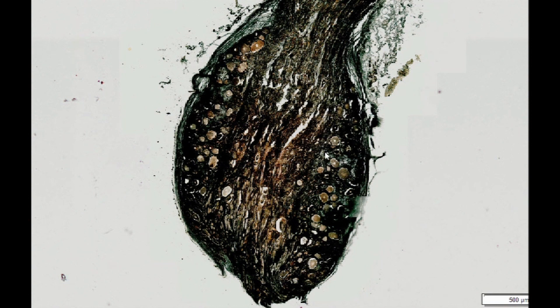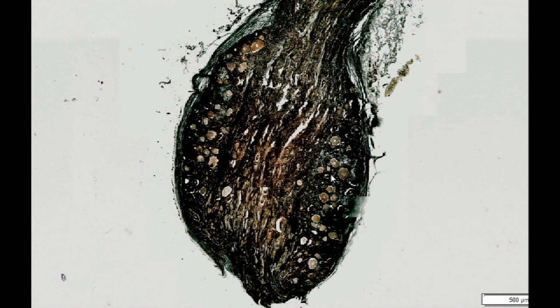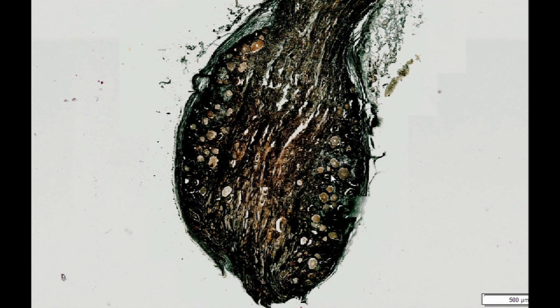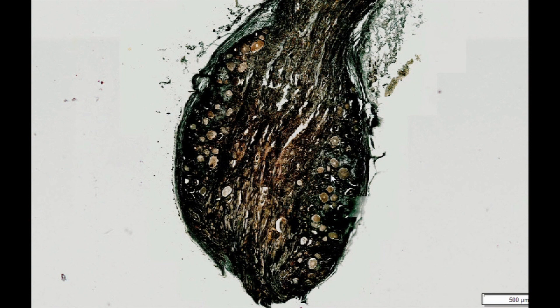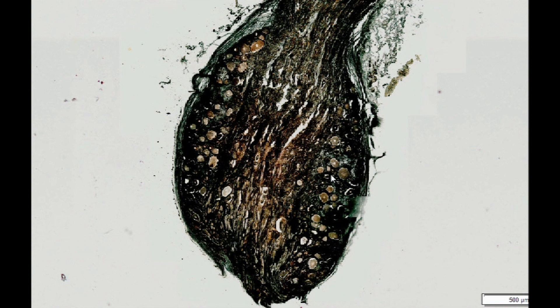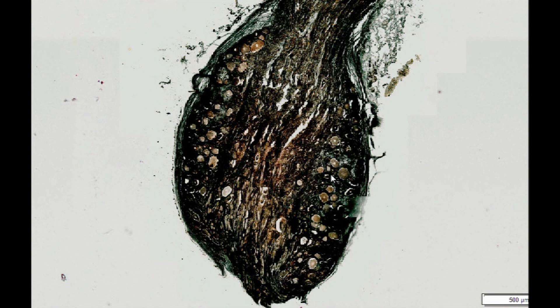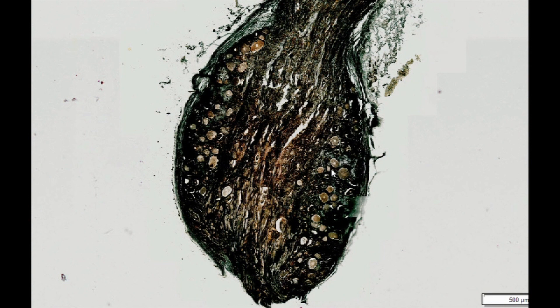It is not without reason that the Golgi apparatus was presented within neurons. The history of the discovery of these intracellular structures is closely related to pioneering research in neurohistology. In 1873, Camillo Golgi developed an innovative method for staining nerve tissue which made it possible to study the connections between individual neurons. This method involved impregnation of tissue scraps with silver salts.